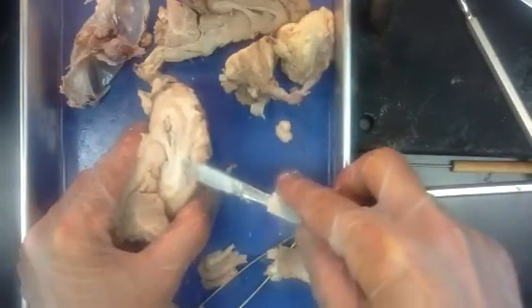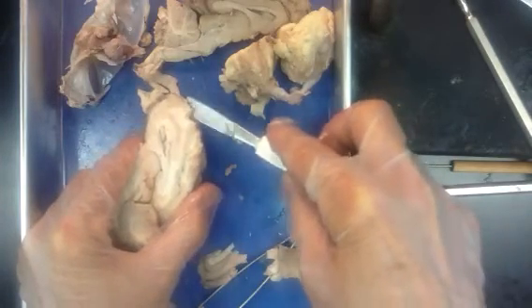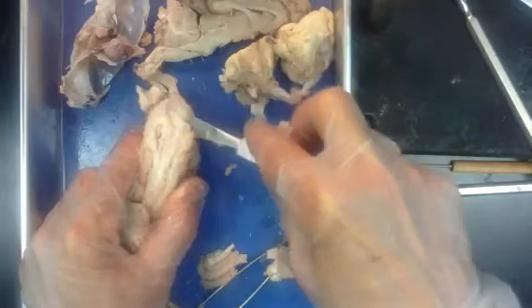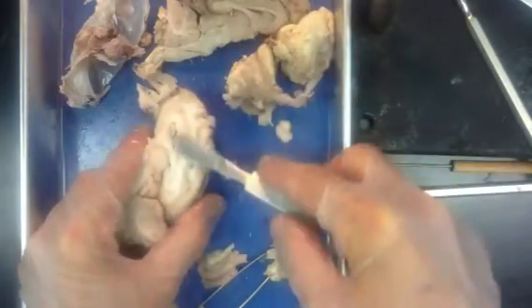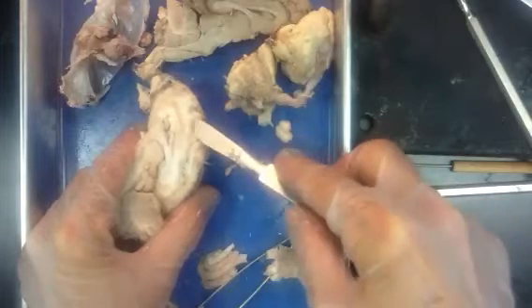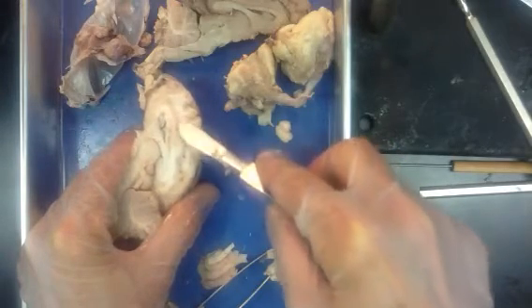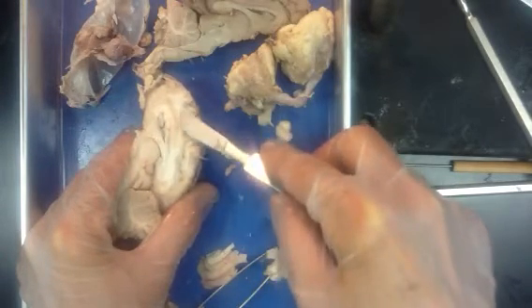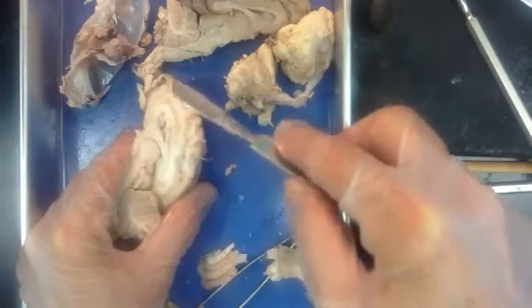The gray or tannish matter is called gray matter because in freshly harvested specimens or in a living brain, it is actually gray. Once we put preservative on it, it turns a little bit more tannish. But the darker areas are gray. That's dendrites and cell bodies and synaptic terminals. And the white matter is myelinated axons. So this is information moving, this is information connecting. The gray is where the connections happen.